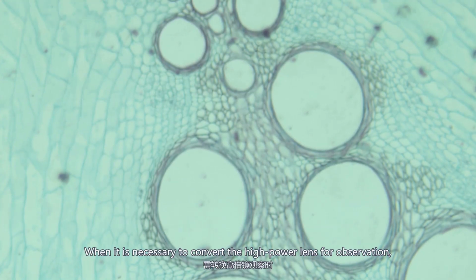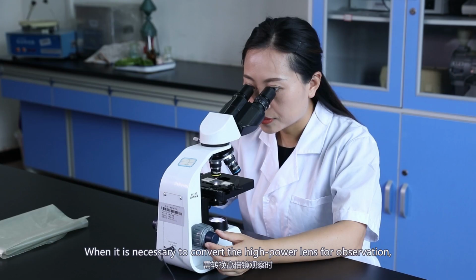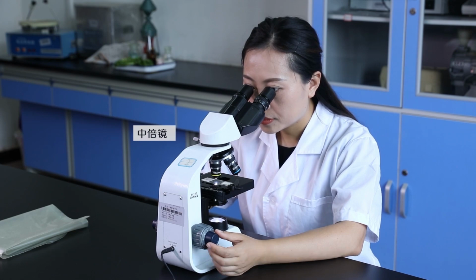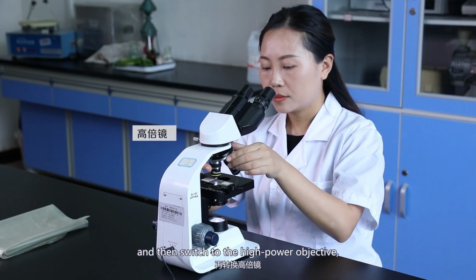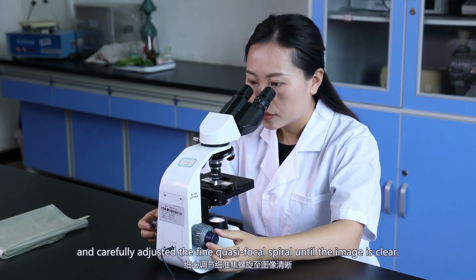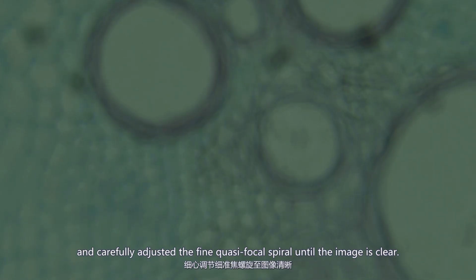When it is necessary to convert to the high-power lens for observation, the object should be adjusted to the center of the field of view under the medium power lens, and then switch to the high-power objective, and carefully adjust the fine focus spiral until the image is clear.